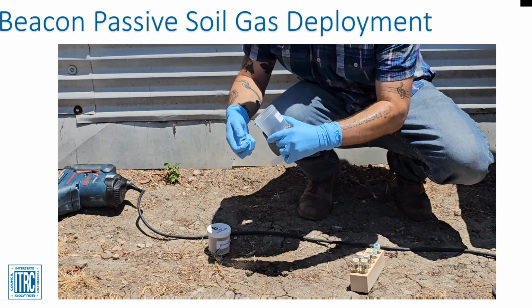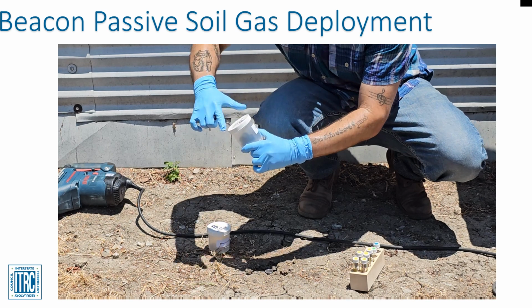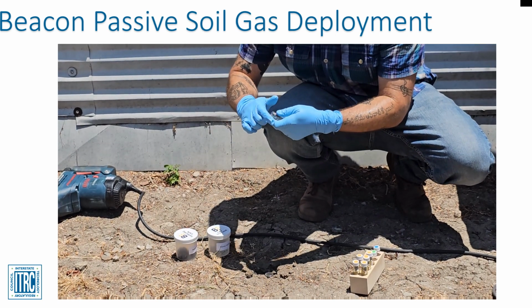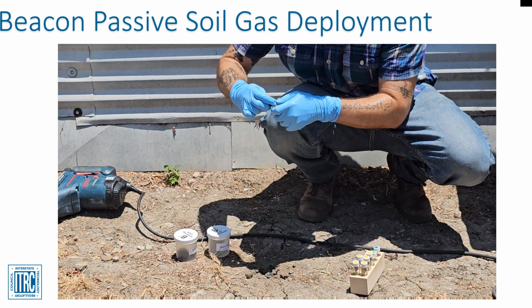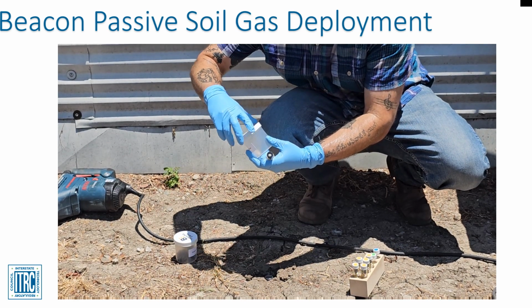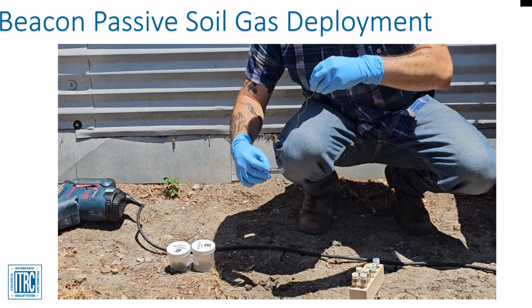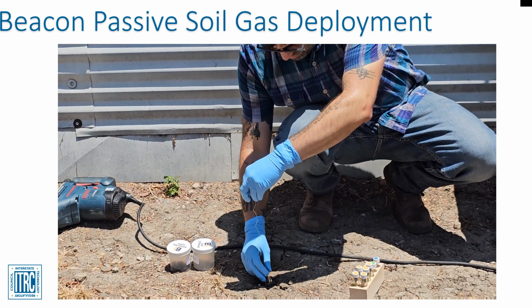Once the boring is drilled, the field personnel will insert a 12-inch long piece of pipe so that it rests about a half-inch below grade. Before installing the sampler, the field personnel should replace the closed cap with the open cap, equipped with a permeable membrane. The solid cap is saved in the dedicated box for future use during the sampler retrieval.